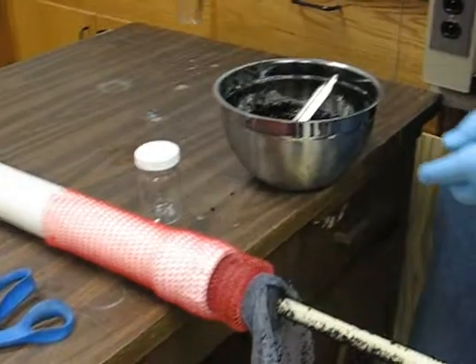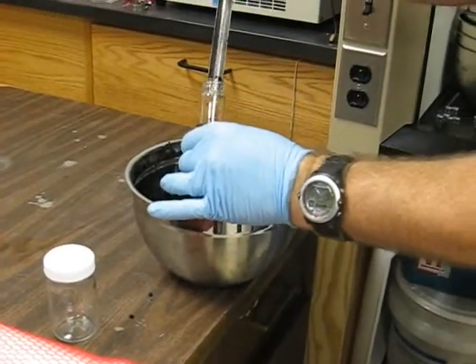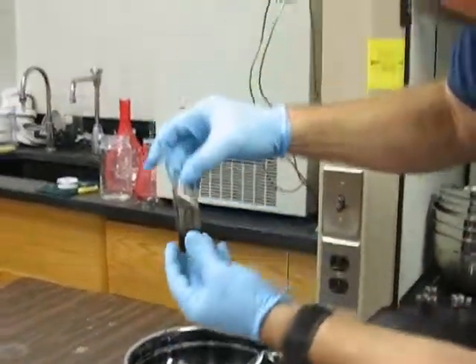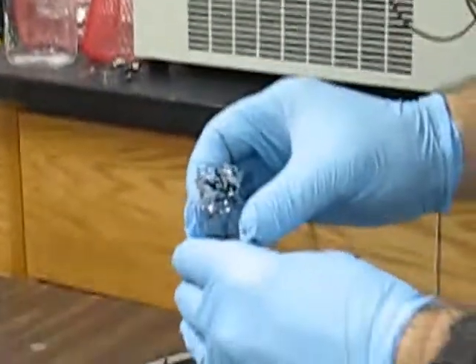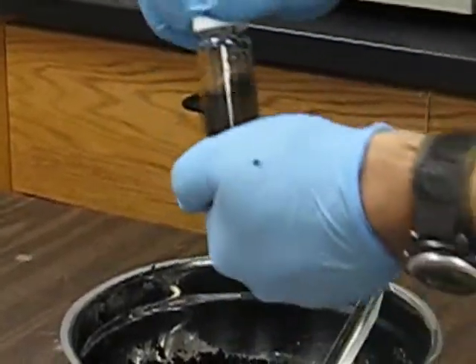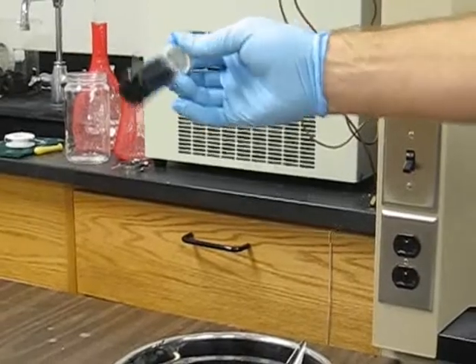I'm going to demonstrate two types of samples we typically take. The first is a sample where there's already alcohol in the vial for preservation — we typically do this for the tracers. We put activated carbon into the vial, shooting for about two centimeters of activated carbon in the bottom. Wipe off any excess granular carbon, making sure none is on the rim of the vial, then seal it with a Teflon cap — it's very important these are very tight so they don't leak during transport before analysis. Later we'll mix, homogenize, and rotate them for sampling.